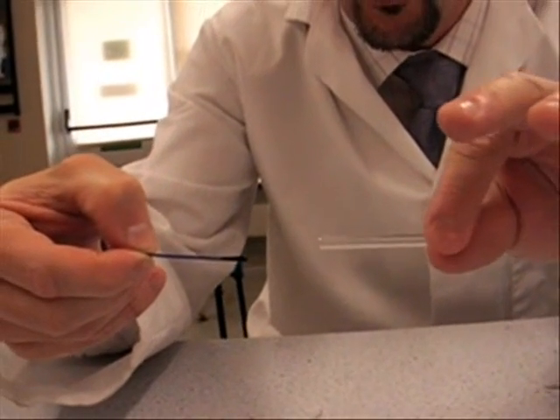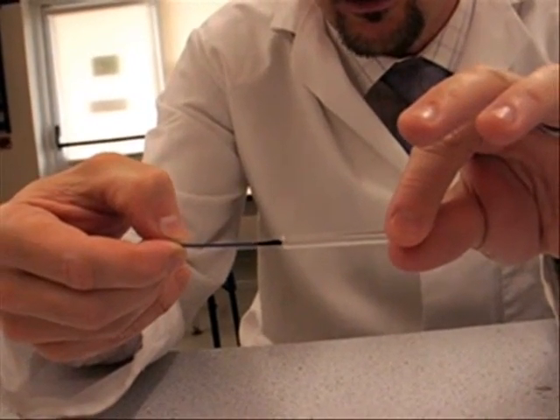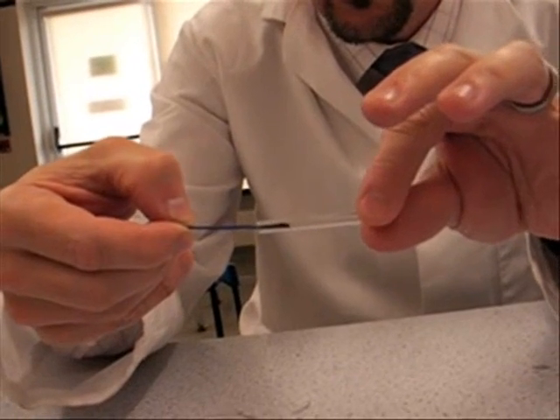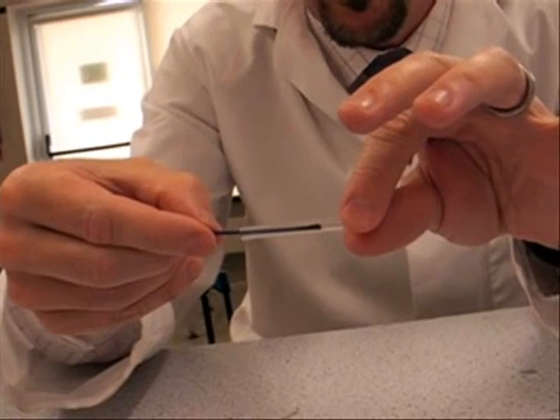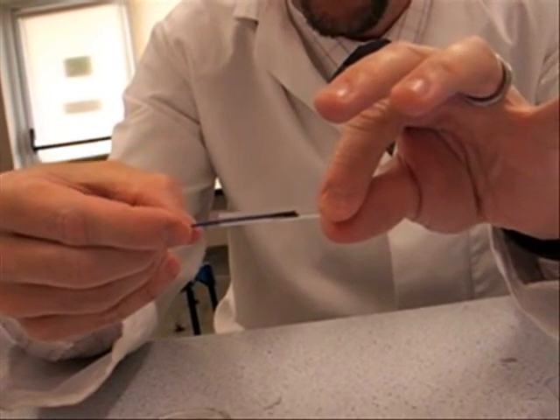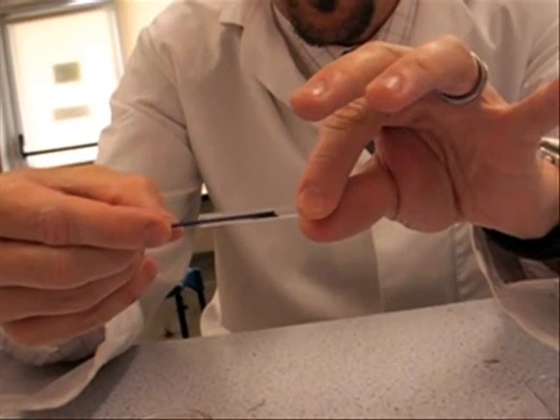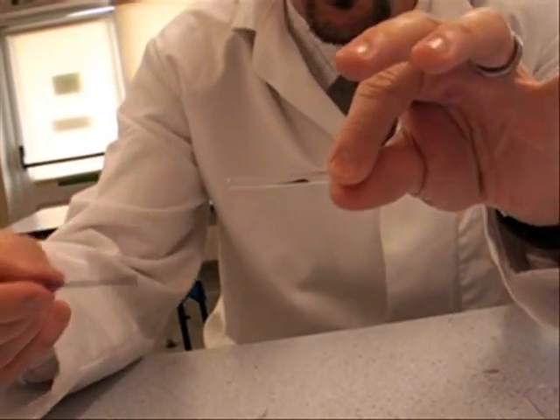For this one, you use the thin end of the micro spatula. And take a tiny, I don't know if the camera can pick up just how small that is, that amount. What you do is you hold the tube horizontally. And it's a bit like threading a needle. Slide the copper oxide to the middle, tilt your micro spatula, and then withdraw. There we go.